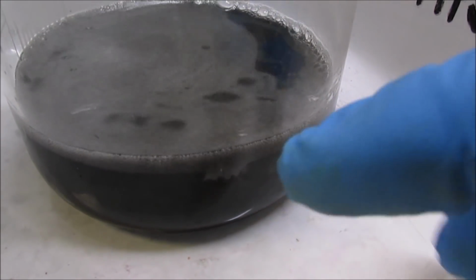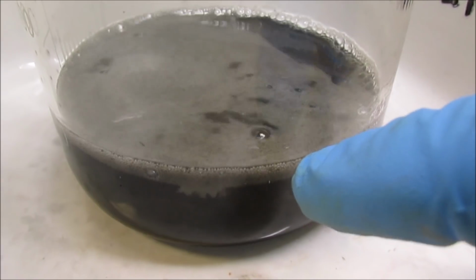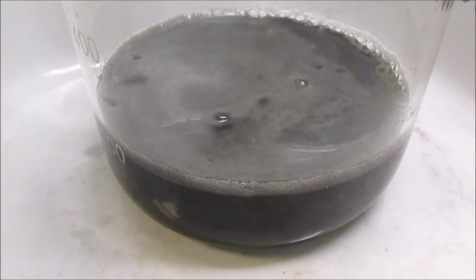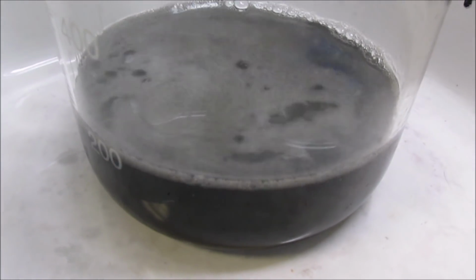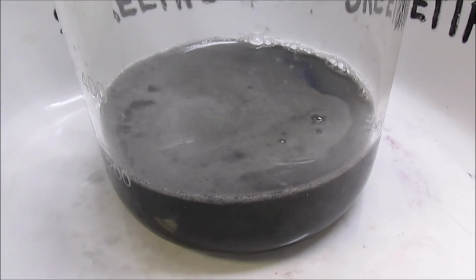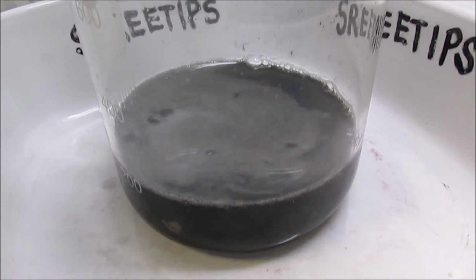Here you can see those pieces of zinc dissolving from the cold hydrochloric acid. I'm going to wait till all the bubbling stops. That will indicate that I've got all the zinc out of there. And then we'll let this settle, decant off the solution, try to rinse the powder one time, and then we'll go with the hot hydrochloric boils to remove copper.